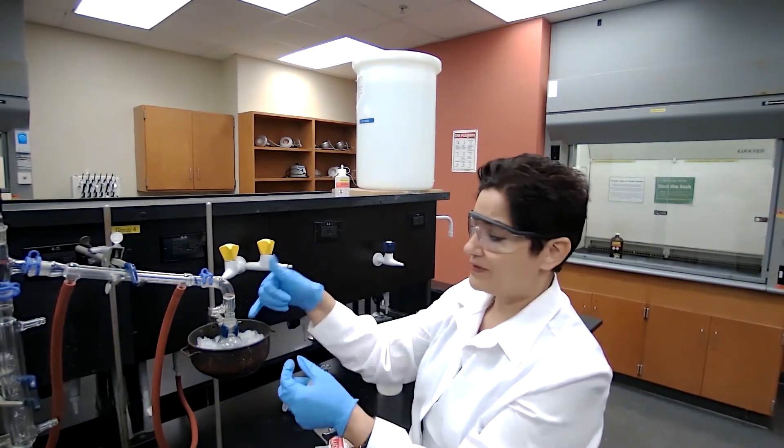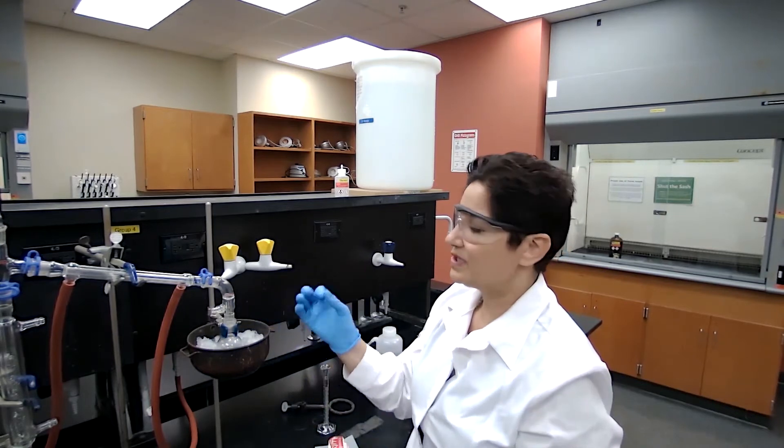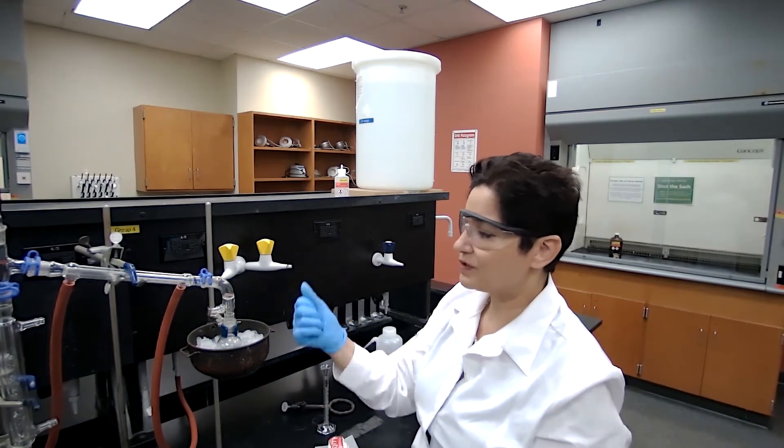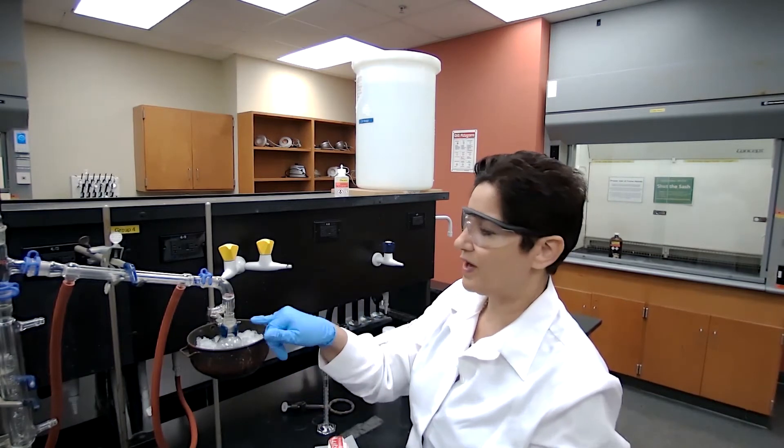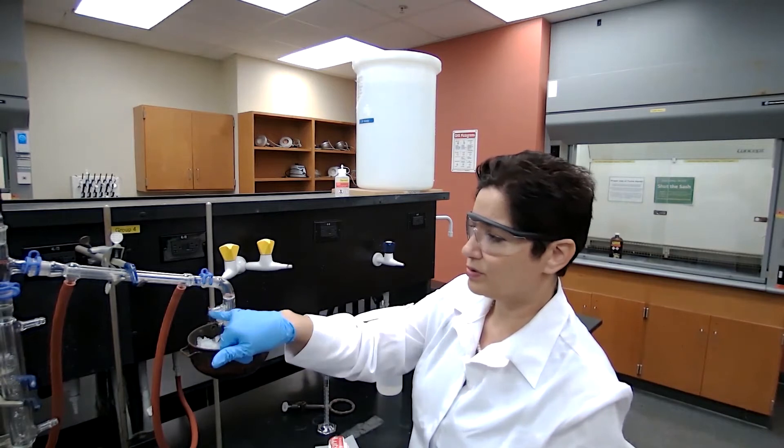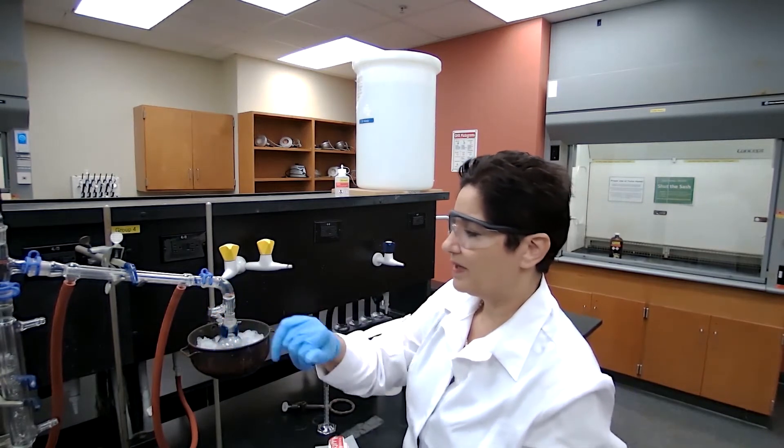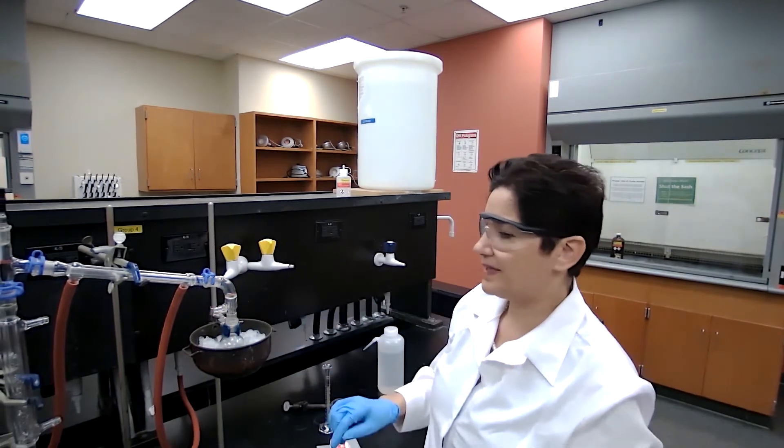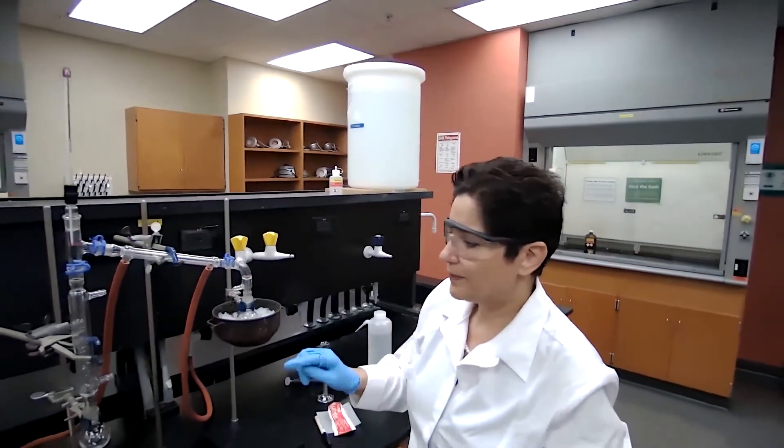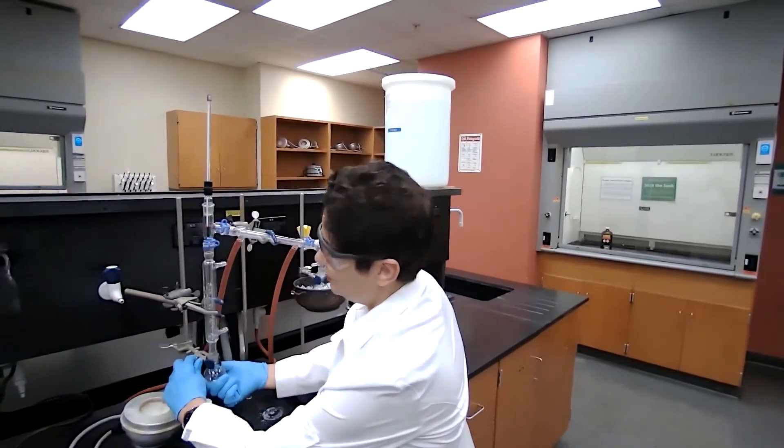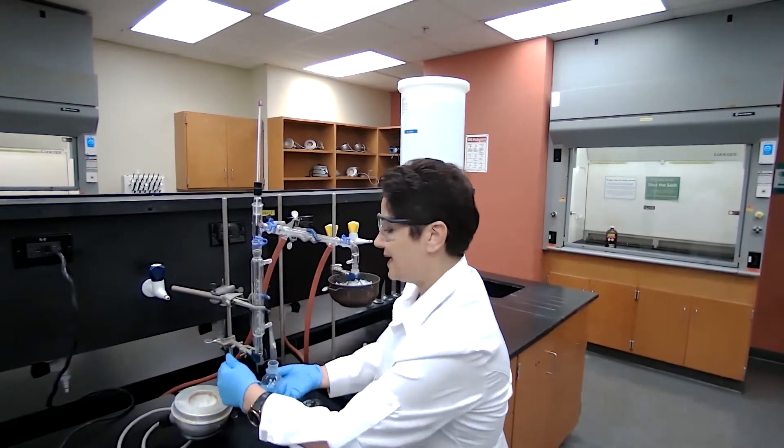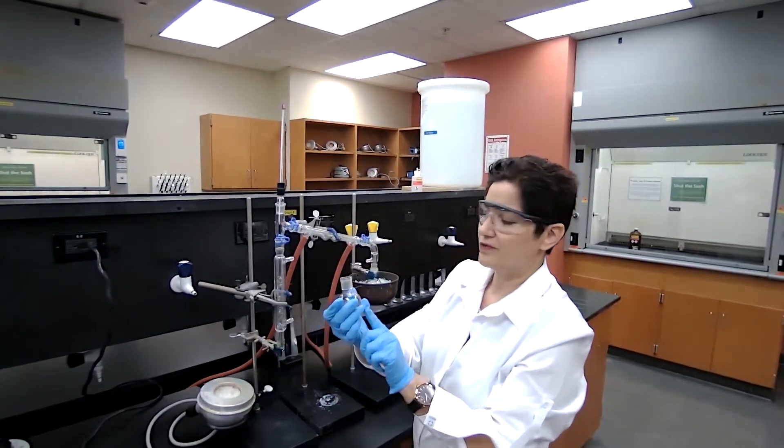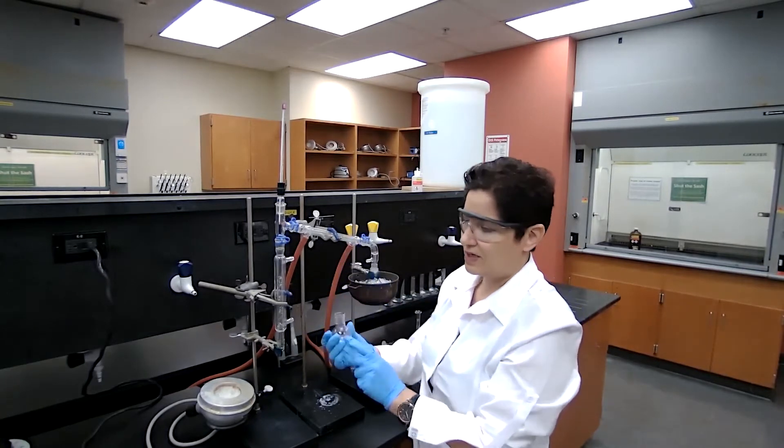I'm surrounding my receiving flask with ice so it would capture the vapor and condense it and keep it in liquid form. We are not going to lose the vapor through this opening of the vacuum adapter. And all I need at this point is to get my chemicals, so I'm going to go to the fume hood.